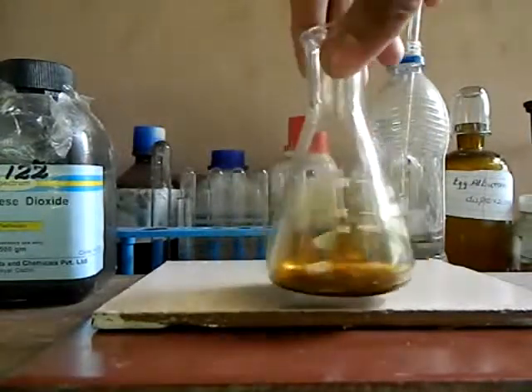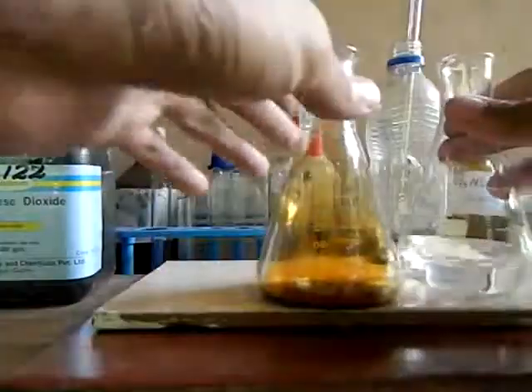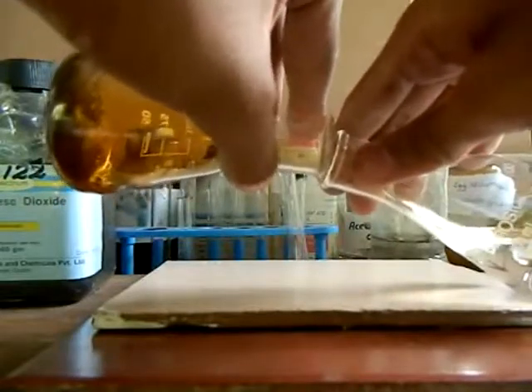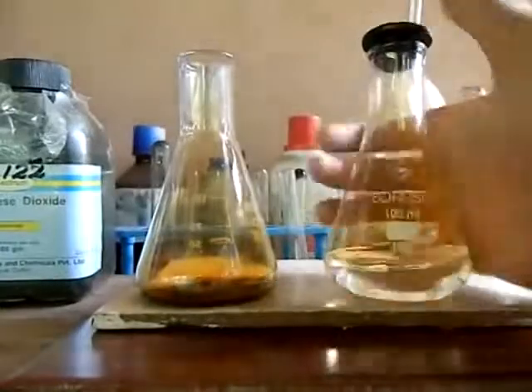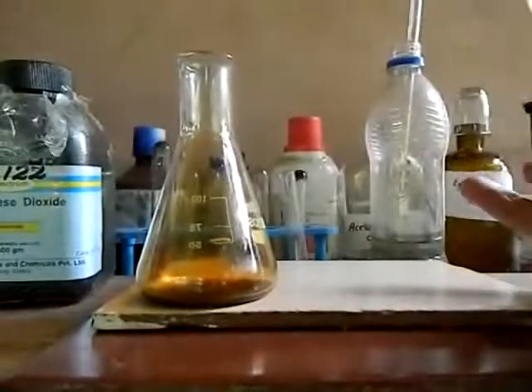I will show it to you clearly by placing this white sheet. Now I take a conical flask with deionized water. As you know, bromine is denser than air — it flows down like water and could be collected in another flask with water. Swirl the flask well to mix the gas. Now we get a golden yellow to orange solution. It is the bromine solution.